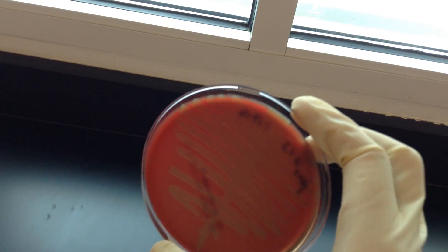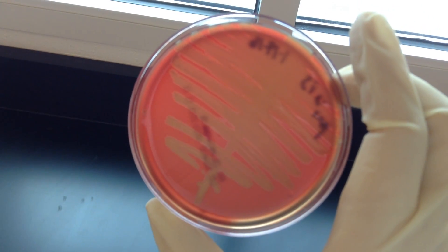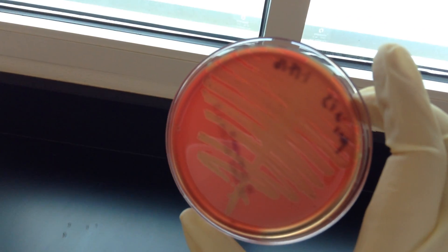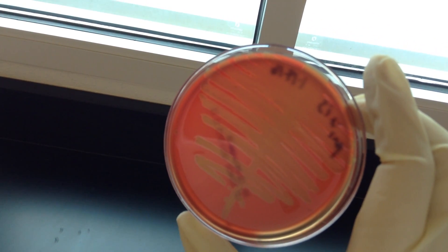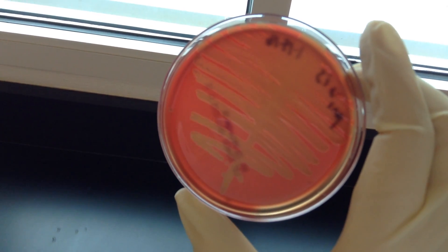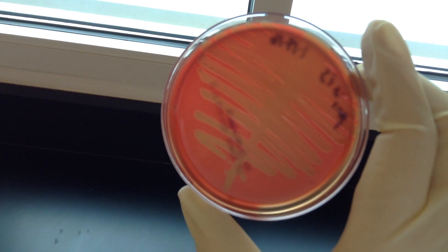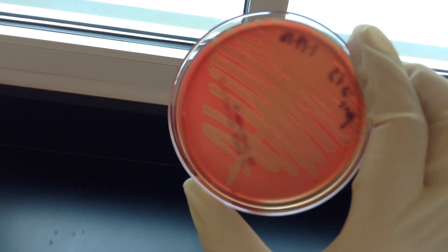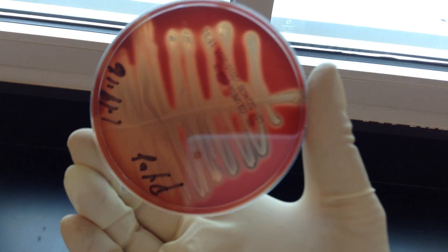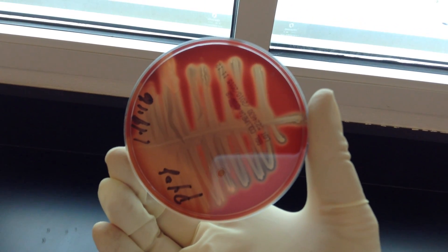We can also look at the bottom — you can really see it pretty well there. These particular organisms have some hemolysis, so they can partially break down blood into a substance called methemoglobin, which is an intermediate product that gives this greenish cast appearance. In contrast, you don't see the clearing here. Compare that to what we saw with beta, where you really see that clearing.